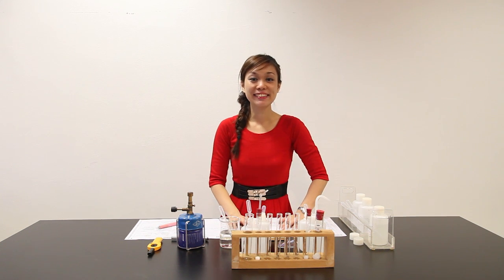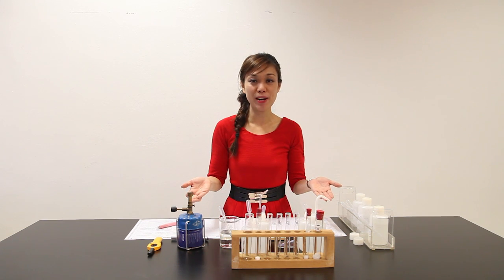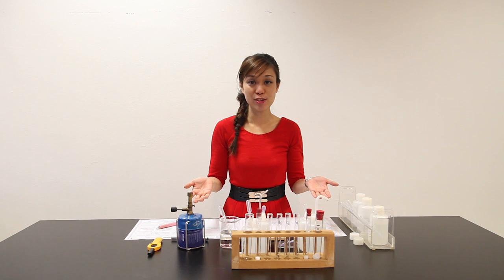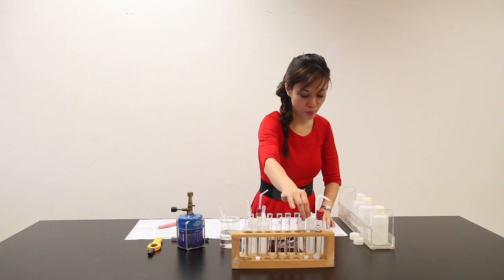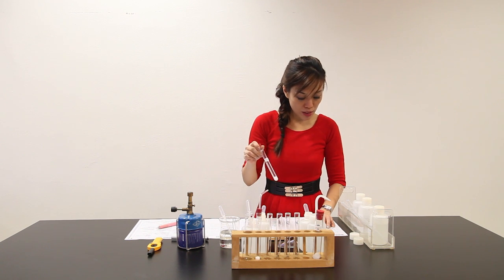As you can see over here, we have already finished preparing, so let's begin the execution. The question says remove the stopper from the small hard glass test tube, which is this one here, labeled salt tube.